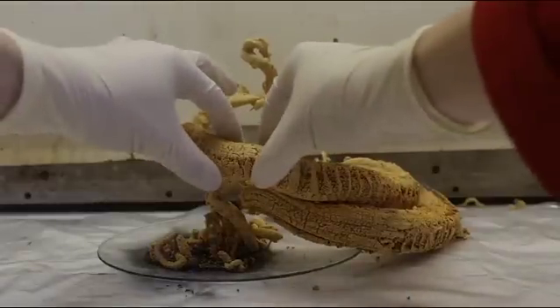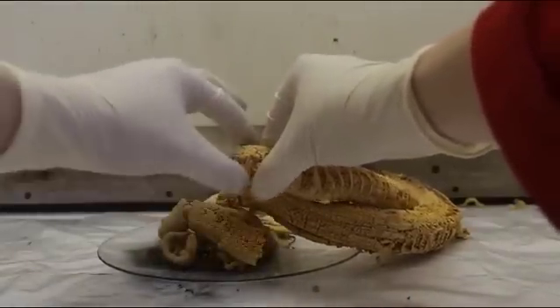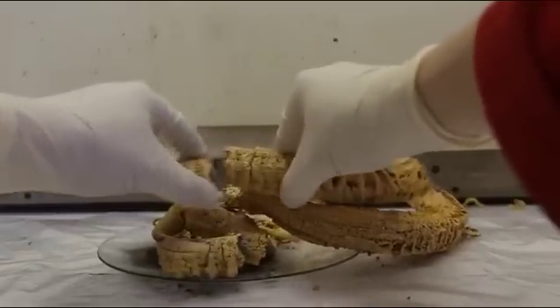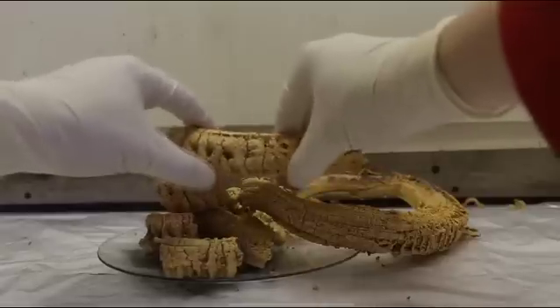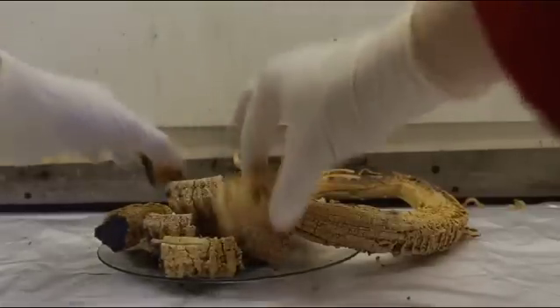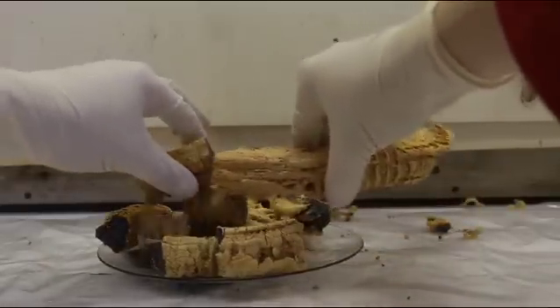This is just a demonstration to show how fragile and brittle the resulting ash is. The snake is made up of almost entirely carbon nitride. The carbon nitride is quite spongy and it contains a lot of the gases produced in the reaction inside of it. So when the snake is broken apart to clean it up, you must also be aware that gases will be released when you break the snake apart.